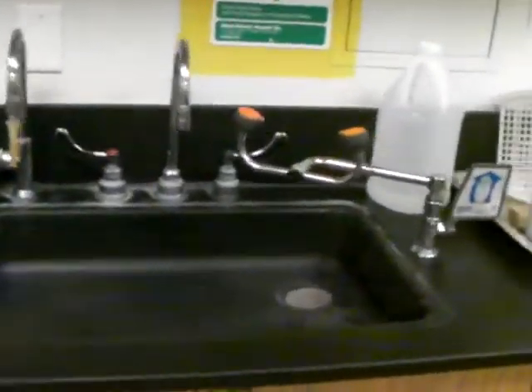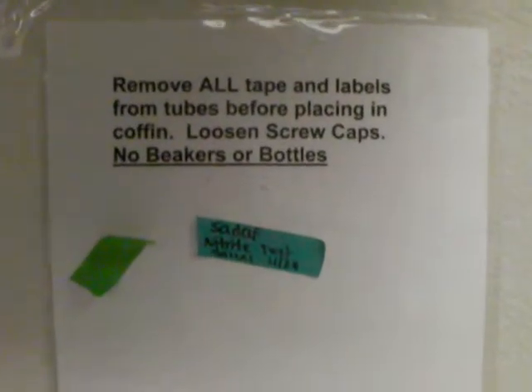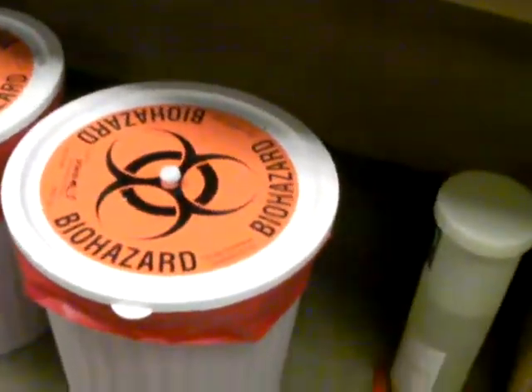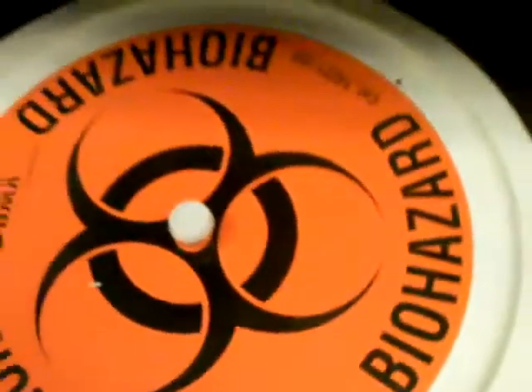Here is where you are going to be rinsing your stuff and washing your hands. What you see here — this box is what we call the coffin. This is where the used test tubes go, and you are supposed to remove the tapes from the test tube, otherwise your name will be exhibited there. This is where you are going to leave your used test tubes. These big bins, as you can see, have big orange biohazard labels — this is where your petri dishes and other biological materials are going to go.